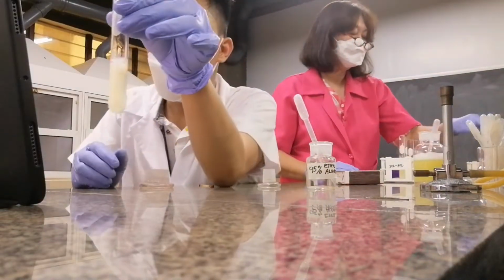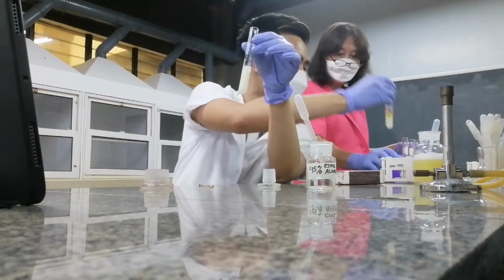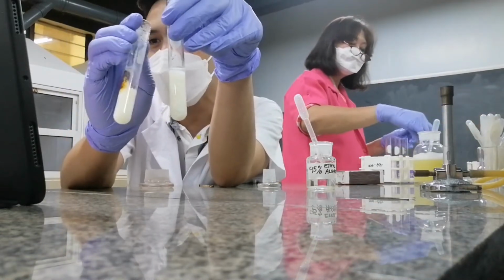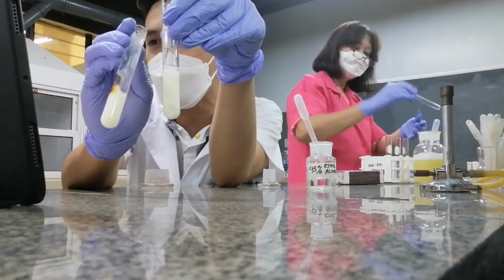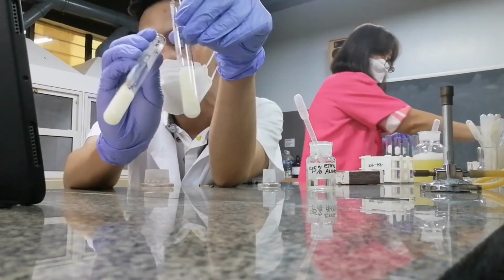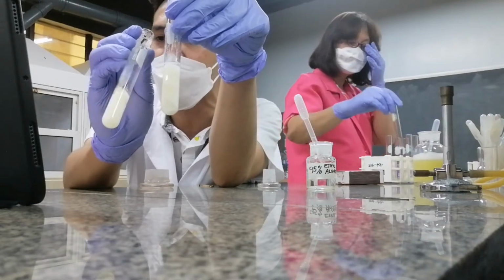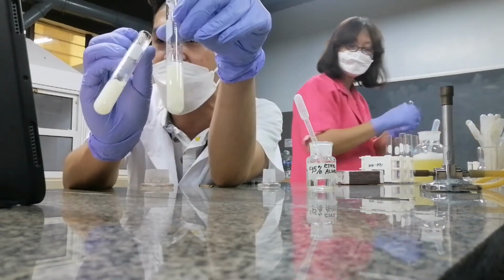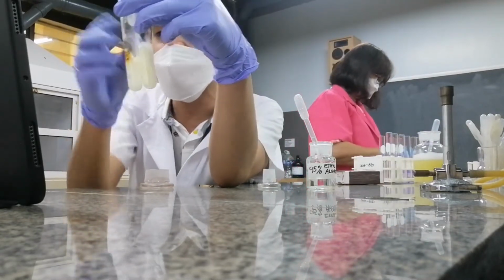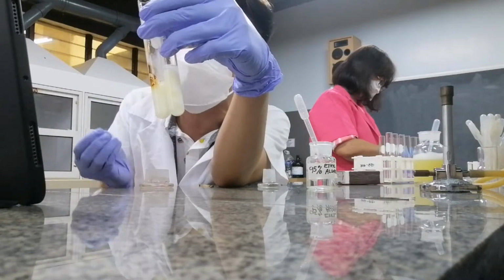Okay. So what did you notice, class? Upon the addition of ethanol, how would you compare it with this? Do they have the same structure? Do they have the same product? What do they form? Did they form precipitate or coagulum? Both heating and adding alcohol actually coagulated your egg albumin, right? So therefore, heating and alcohol can coagulate your egg albumin or your other proteins.